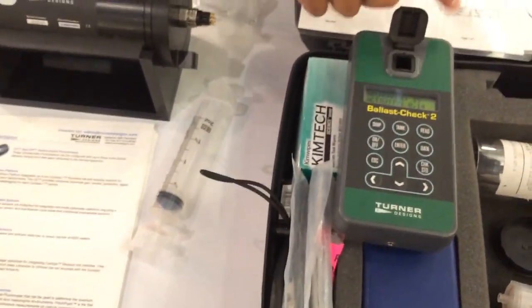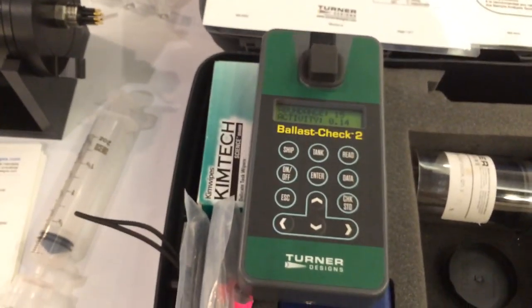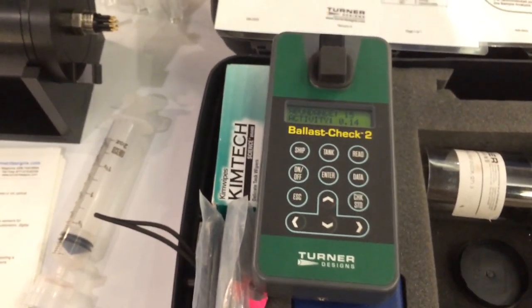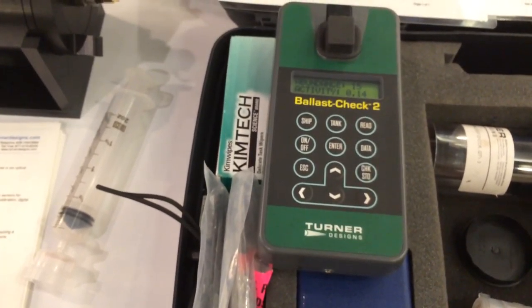So I'm okay to take my ballast water and dump it overboard. And that's what it sounds like. So you guys are mostly selling to ship operators, ship owners, anyone working on a ship who has a treatment system they want to validate or verify, and port state officials.